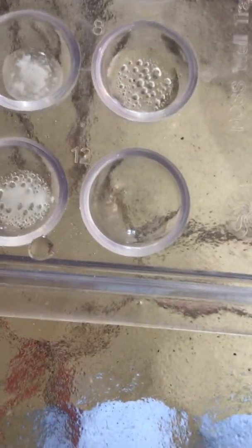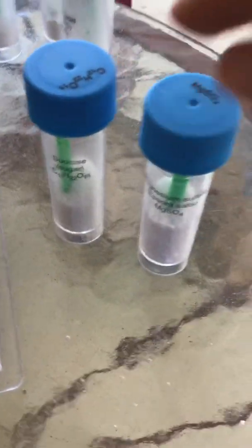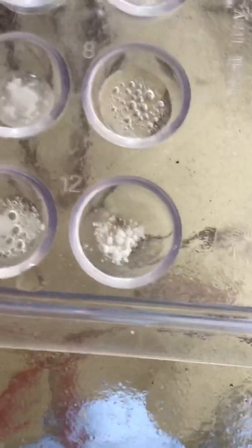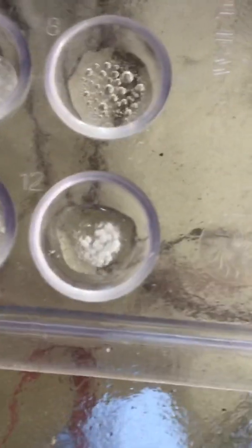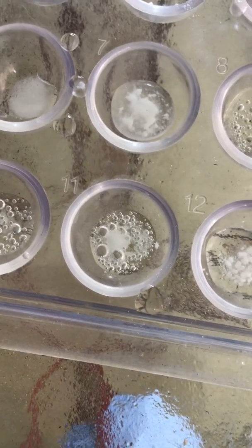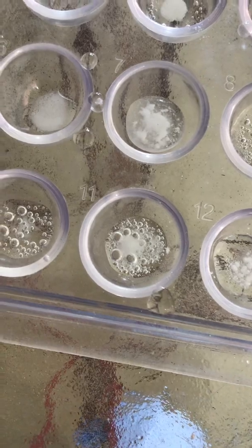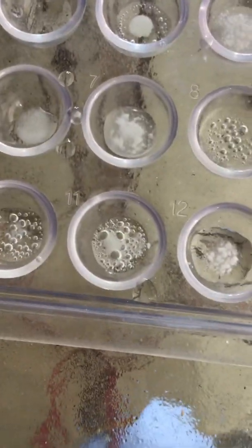We'll come back to that in a minute. Next, I'm going to try sugar and Epsom salts—sucrose and magnesium sulfate. I'm going to add some water. Doesn't look like there's much of a reaction. This one is still going. I'm thinking it's probably the most similar to the mystery mixture, but I guess we'll find out in the next lesson.